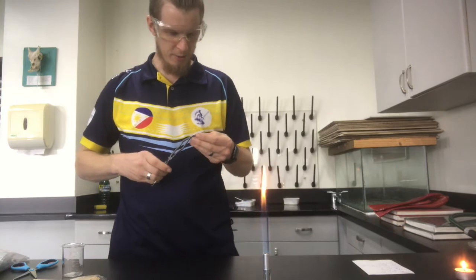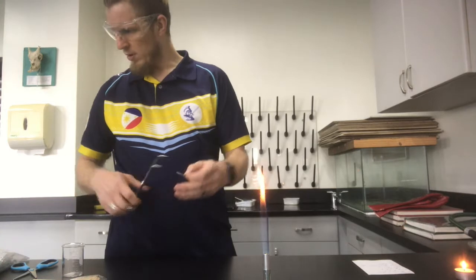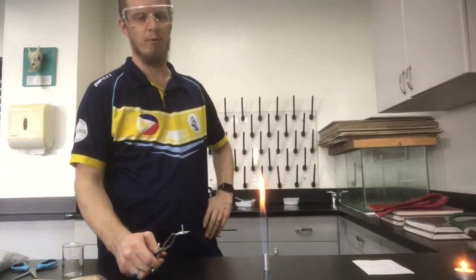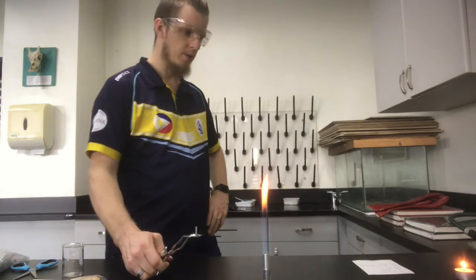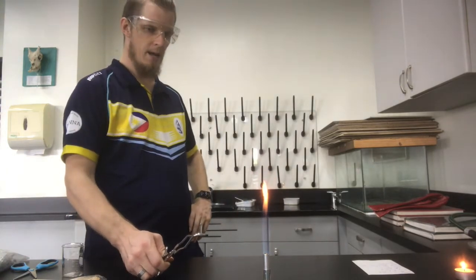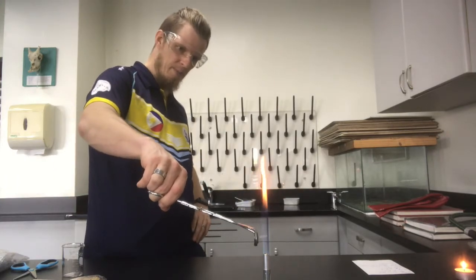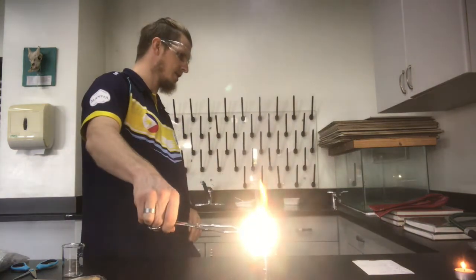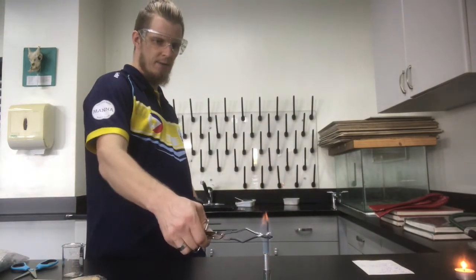But you'll see quite quickly when we're making magnesium oxide, because essentially this metal is going to burn. It's going to burn with a really bright white flame. Obviously it's not going to be an issue for you guys because you're looking at it through a camera, but when it starts burning, I'm going to be looking away. So I'm going to drop it into my Bunsen burner here. The blue flame is hottest. Okay, and there you go. You can see it there. I'm looking away because I don't want to burn my retina. Okay, let's see if we can get the other part going.